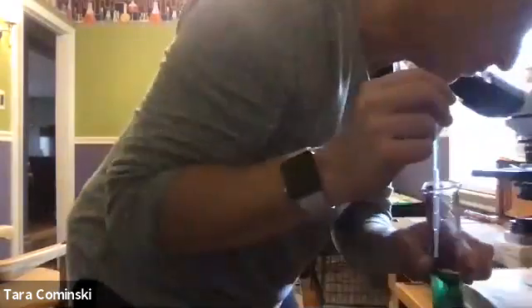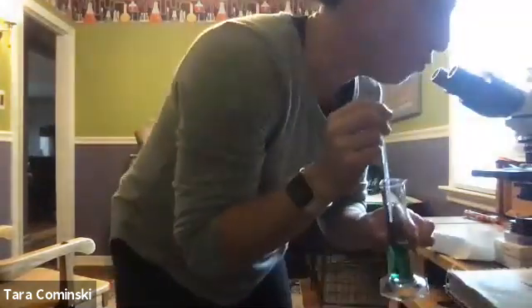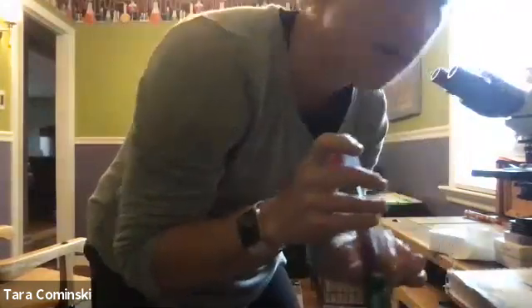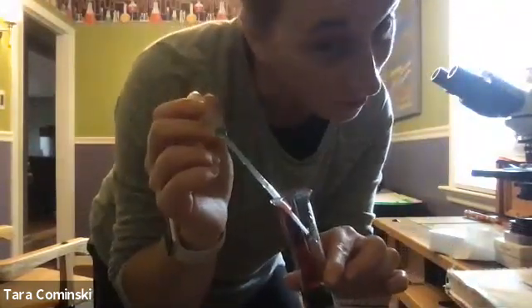Okay. So it says now perform the operation you suggested. You're not going to be able to do that. That's fine. Again, I want you to just tell me how you would do it. So you're sort of skipping that second question for number 5, unless you have graduated cylinders at home and you can figure it out.